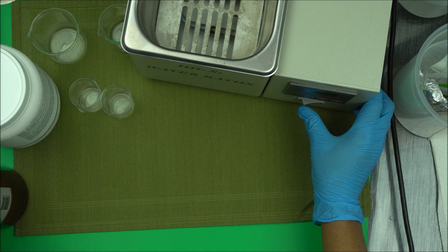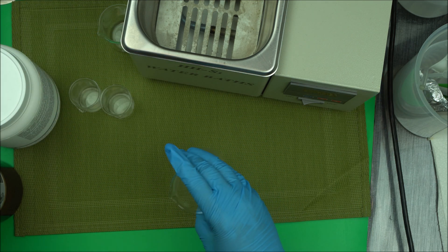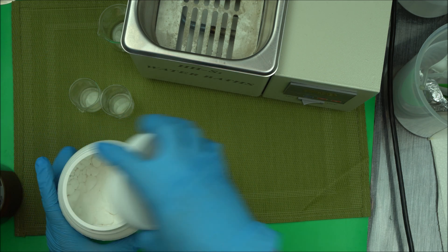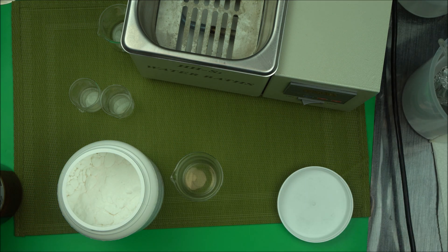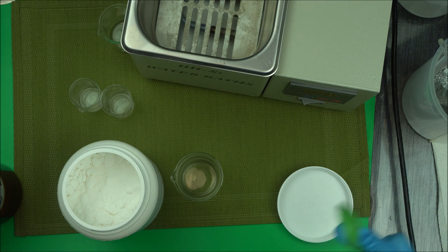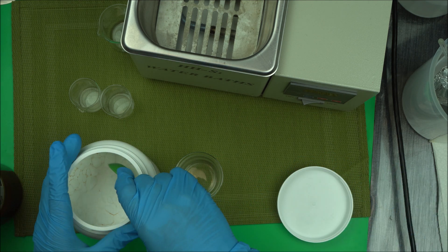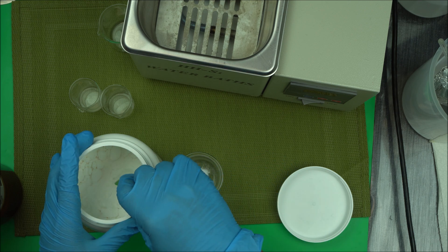The first thing you do is weigh your salicylic acid. You can use it from 1% to 2%. When you are making skincare products for stubborn acne you can use 2%, but for moderate acne or just to exfoliate your skin you can use it at 1%. So take your salicylic acid into your beaker.